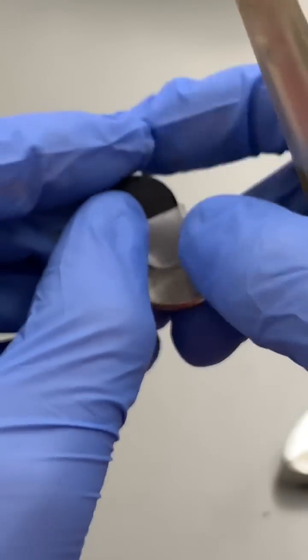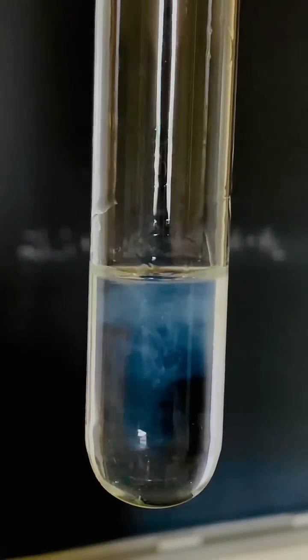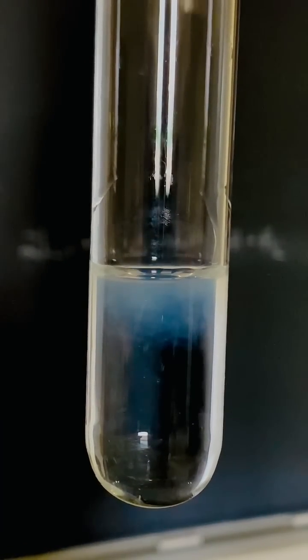It's a lithium battery, so we're probably looking at the element lithium. Let's run a chemical test to see if it really is lithium. To do this, I'll just drop this portion of the battery into some water that contains acid base indicator.